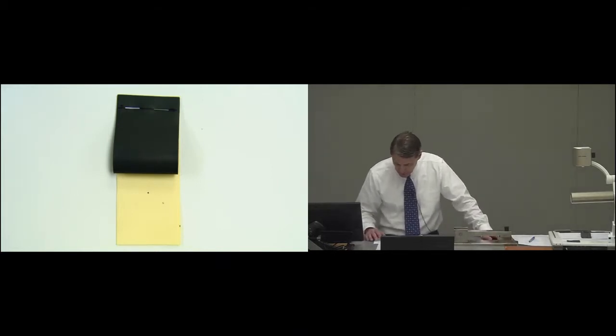This test method is used to predict the behavior of plastic sheeting, geomembranes, at low temperatures. This test method is useful for specification testing or comparative purposes, but does not necessarily demonstrate or determine the lowest use temperature for a particular sheet or geomembrane.